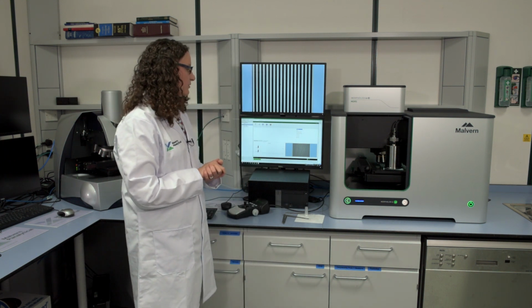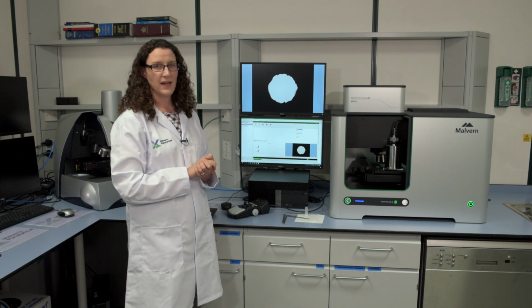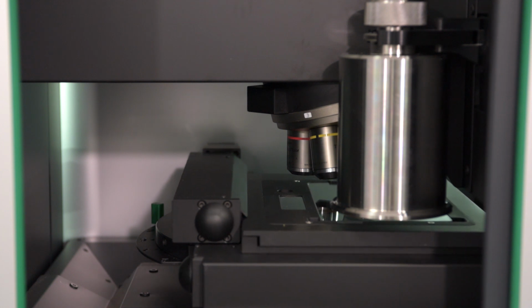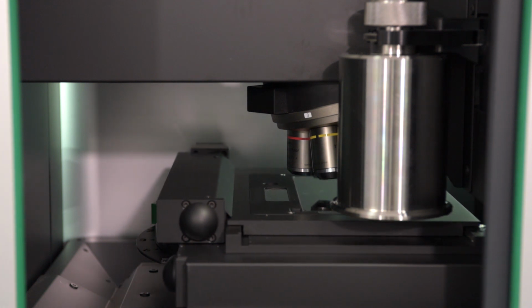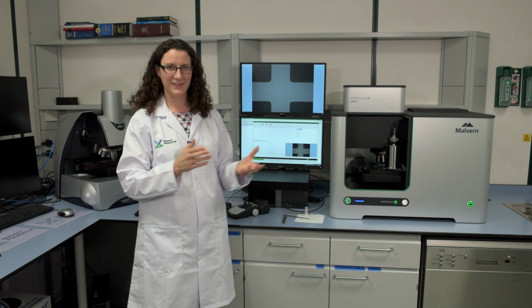Next, the system goes to the pinhole that's within the stage, and this allows it to get an XY reference. And this is really important if we're going to do the Raman spectroscopy part of the analysis later on, because we need to make sure we're going back to the correct XY position where our particles are located. The system is now checking that we have indeed put a glass plate into the stage. We don't particularly want to disperse the sample all around the insides of the system.